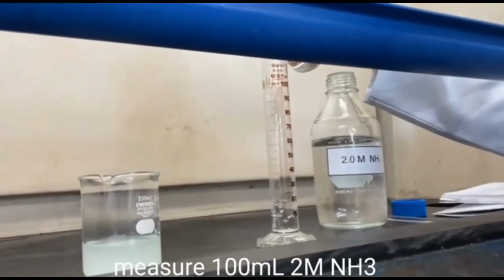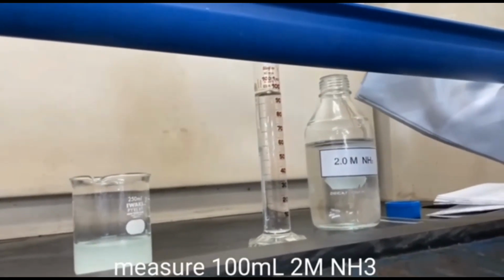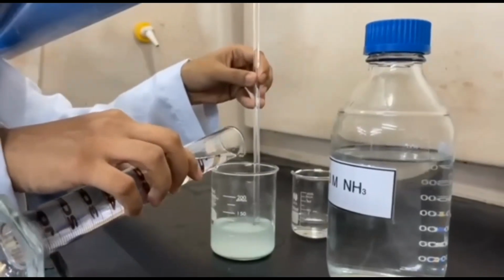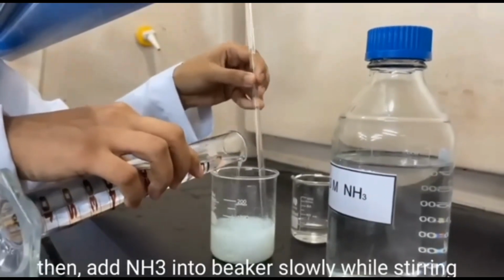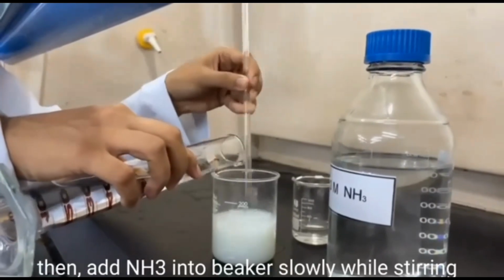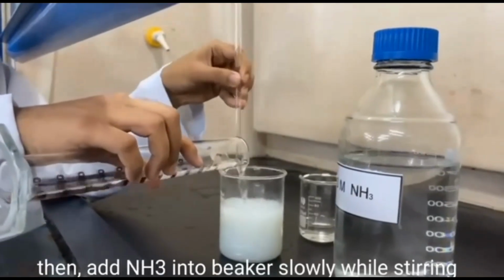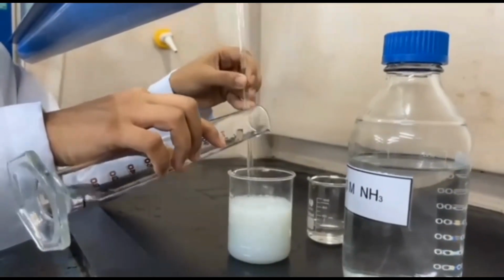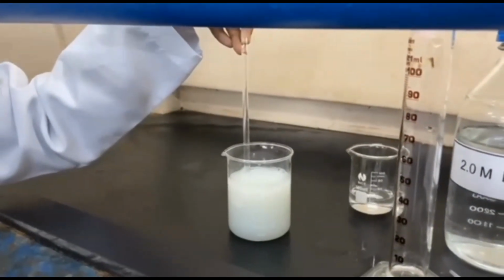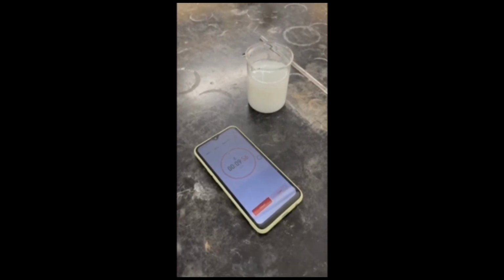Measure 100 ml of 2 mol ammonia. Then add the ammonia into the beaker slowly while stirring. A white precipitate of magnesium ammonium phosphate will form. The mixture is set at room temperature for 10 minutes.